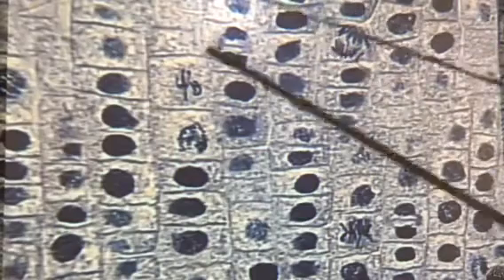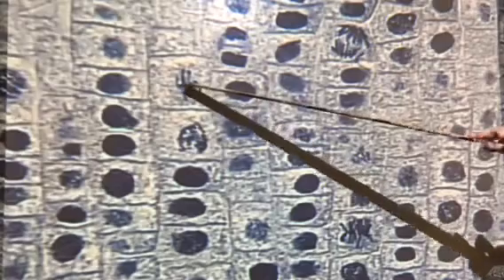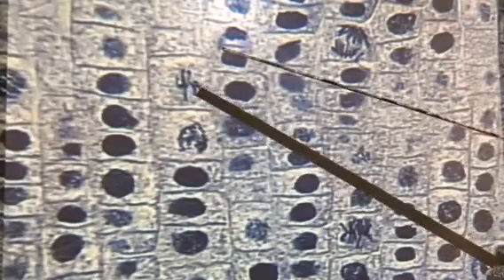I like this one as metaphase right there as well. And this one's close. It's not a great example, but it's close to metaphase. Okay, now the next one, this one's the hardest one to get because it happens the quickest. So remember, this is like a snapshot in time.